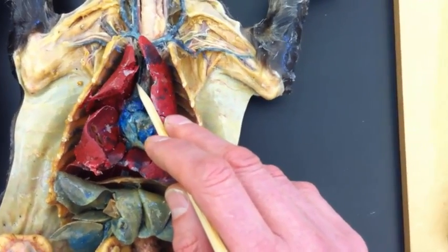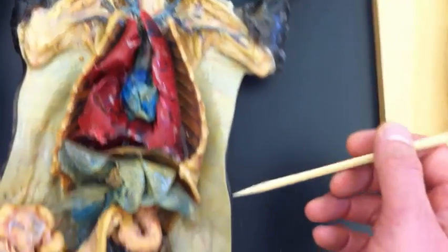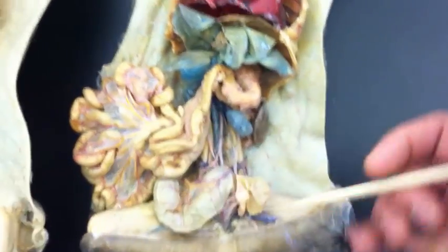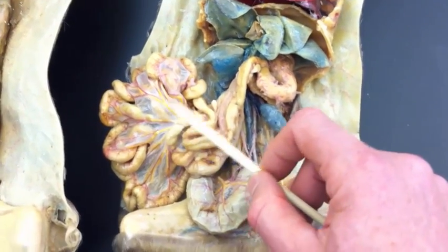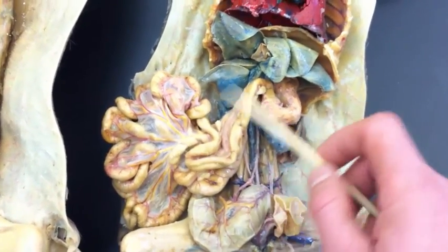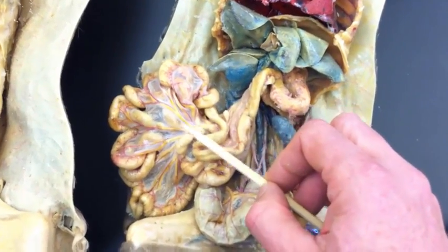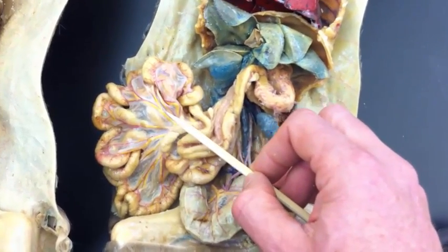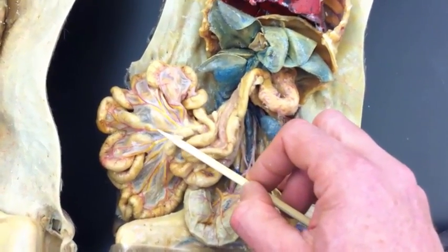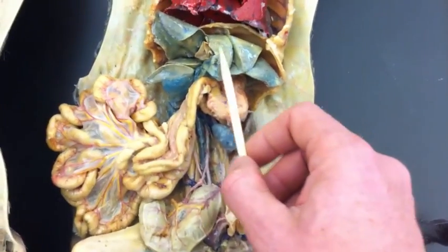There's the superior vena cava. And you can also see the aorta in there a bit. Going south into the abdomen, here the intestines have been splayed out nicely. And in this particular type of dissection, they actually stained these vessels yellow, and these vessels are part of the hepatic portal system. That's a venous system that carries blood from the gut up to the liver.